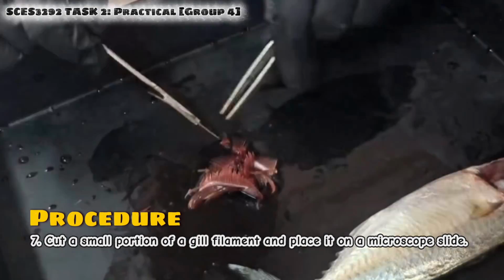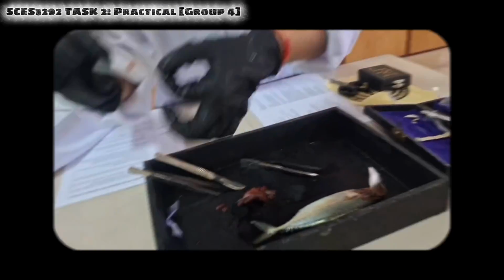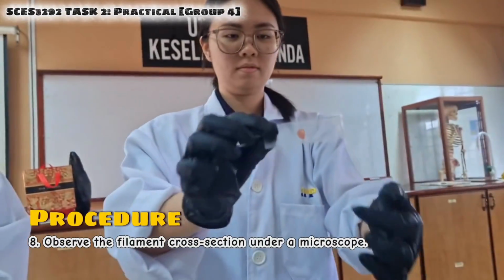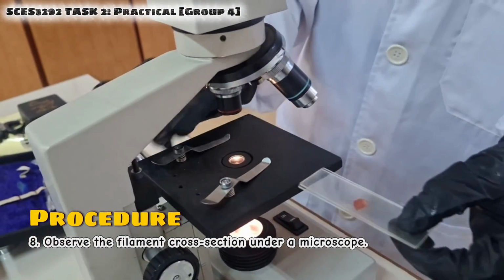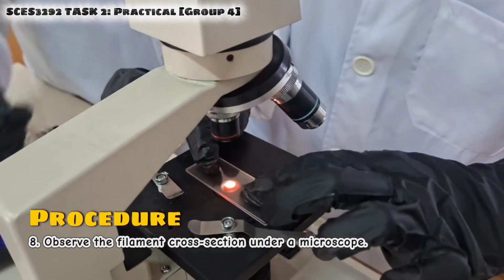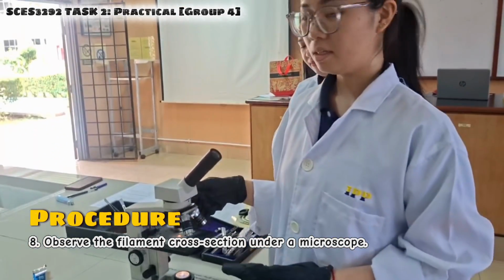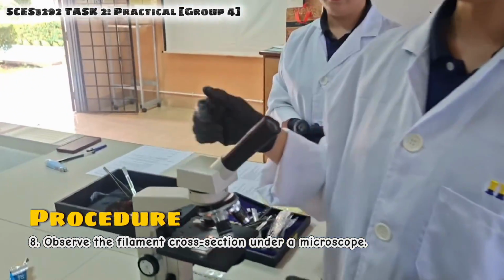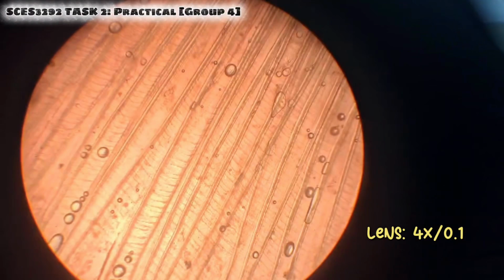Now we are going to cut a small portion of the gill filaments and put it on the microscope slide. Now we are going to put the slide with the small part of gill filaments under the microscope to observe. I'm going to observe the filaments using the microscope with the 0.1 lens. So this is the observation.